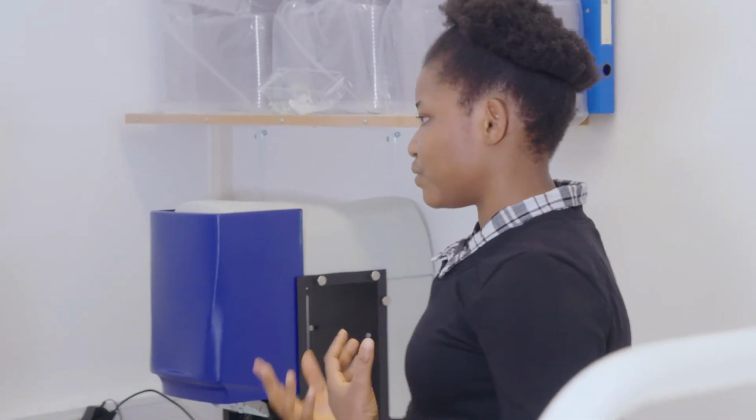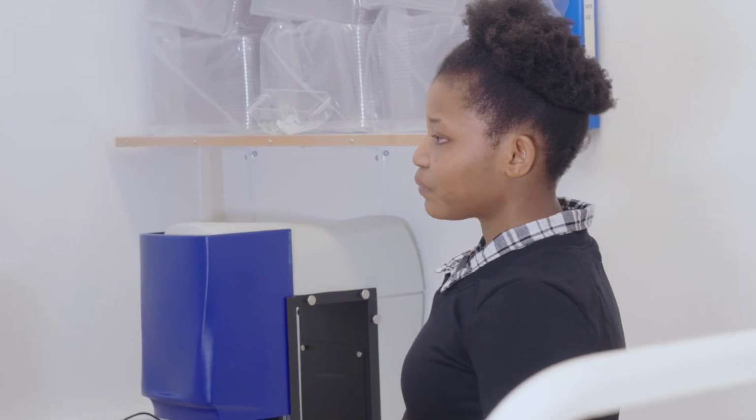I'll briefly take you through some of the behavioral experiments that we do. One is the tracking, which is a simple locomotor assay where we track whether the fish have normal movement or behavior versus mutants or drug-treated fish. I will also show you an example of a behavioral test called shoaling. Just like humans, zebrafish want to be together. They don't want to live in isolation. When you put them together, you can monitor how close they stay together and how far apart they are. It's well shown that zebrafish, when given alcohol, like humans, tend to behave in a certain way and vice versa.